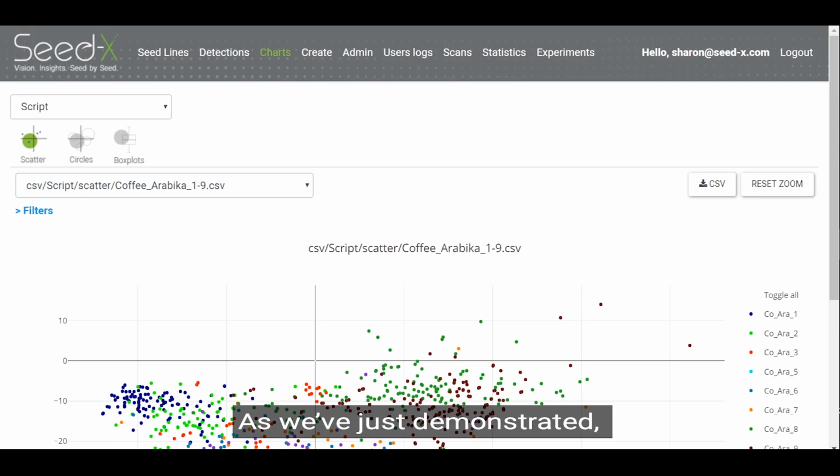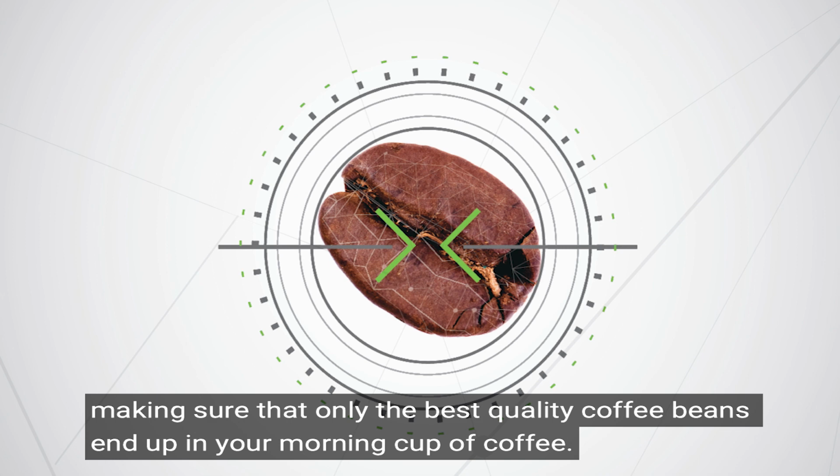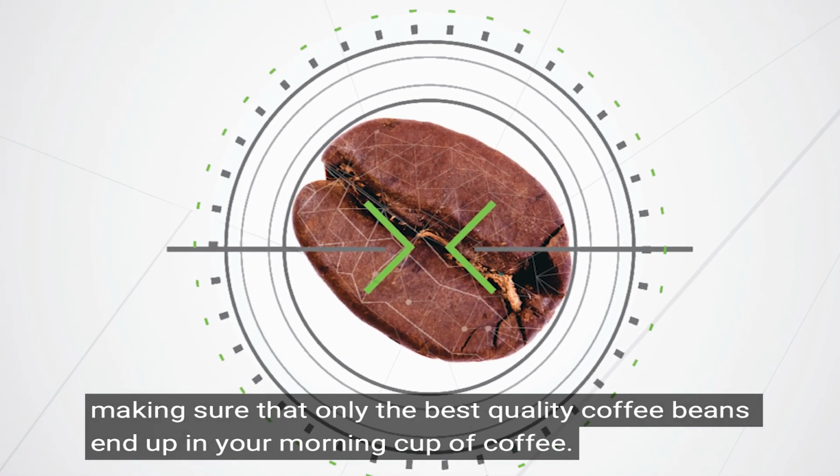As we've just demonstrated, by using the GeNee Envision, you now have the visibility to quickly and easily improve quality analysis for coffee beans, making sure that only the best quality coffee beans end up in your morning cup of coffee.